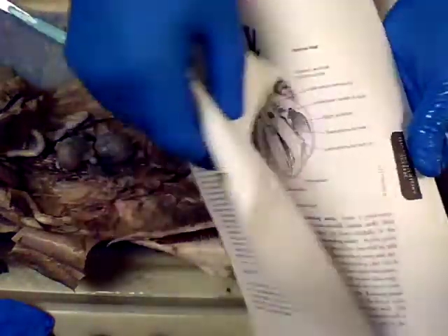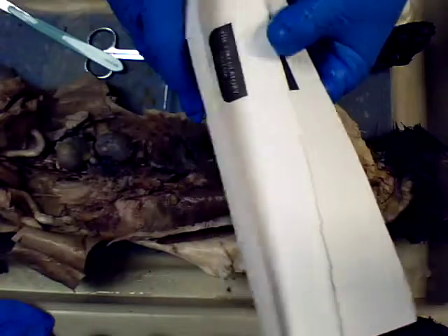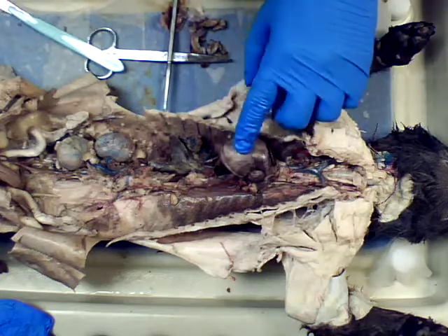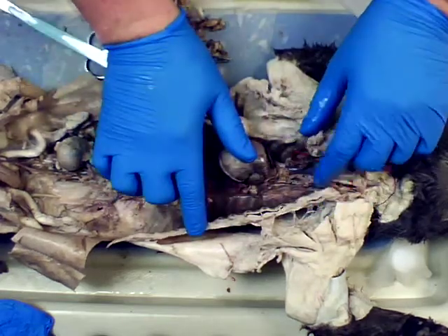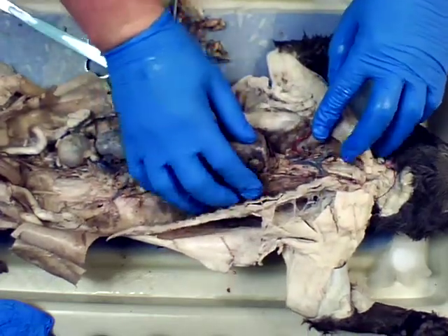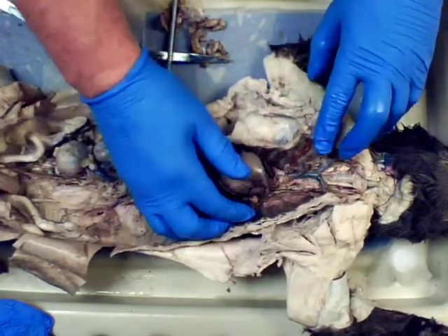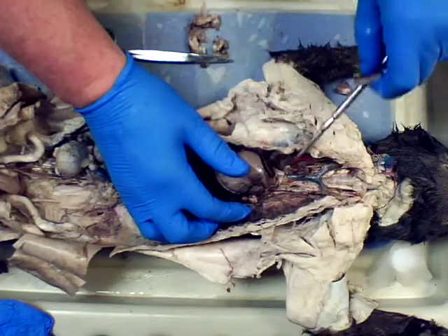With the circulatory system packet that you would have got, there's a number of diagrams of things, and I'm going to try my best to keep this straight this time as I go through it. So what we have when we look at this, I've cut the ribs out of the way and removed the lungs, so you can see this Y shape here. So this is blue.